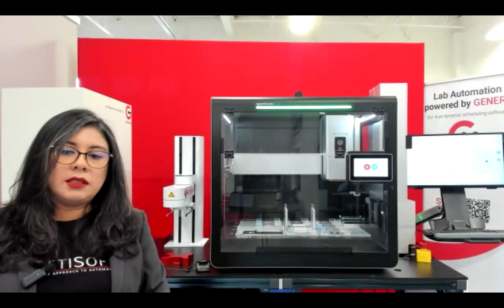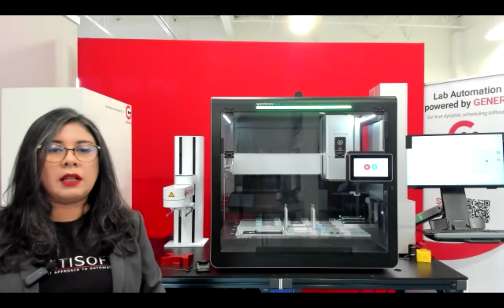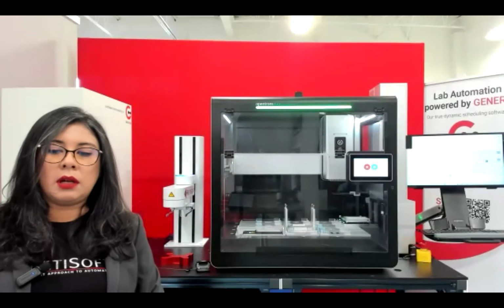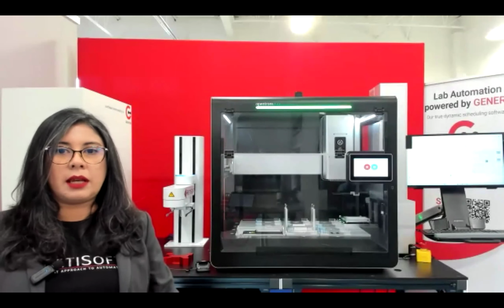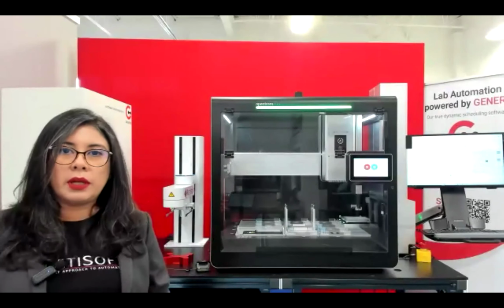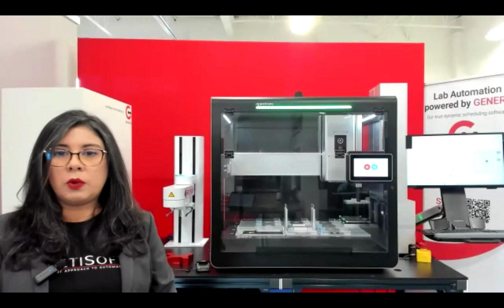So with this level of flexibility that Genera has, the tools that we have embedded in Genera, like the Teach Pendant, the Instrument Viewer, and many others, really increase the capabilities of the entire solution. And that's what we want to showcase as well today. And I will hand this to Igor at this point, where he can demonstrate how we have set up the workflow for this system here.